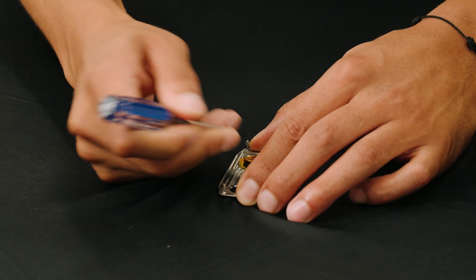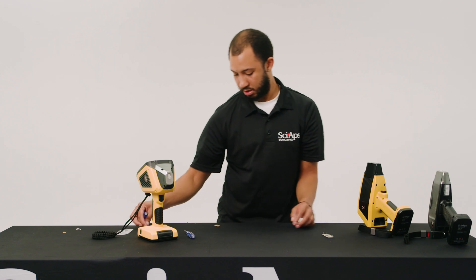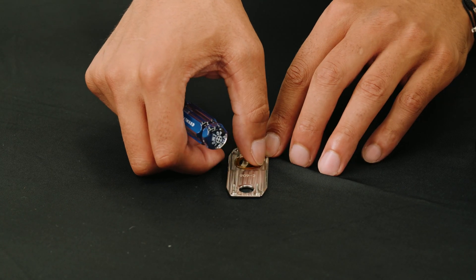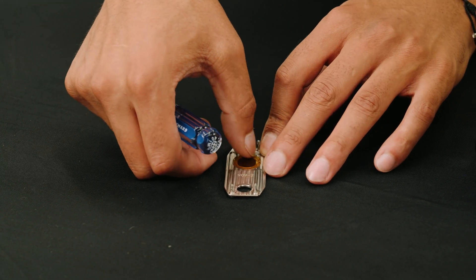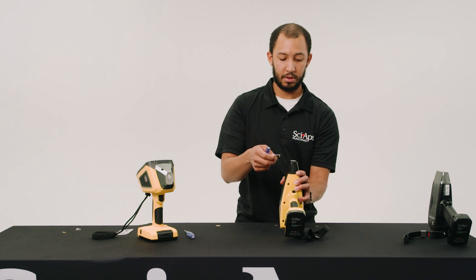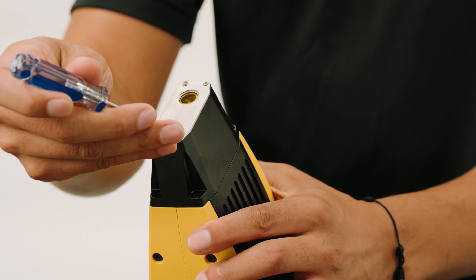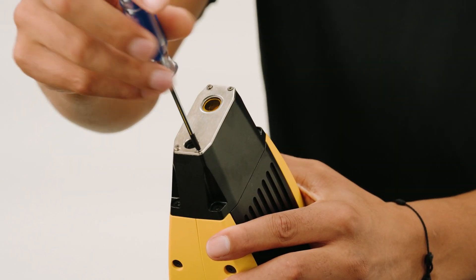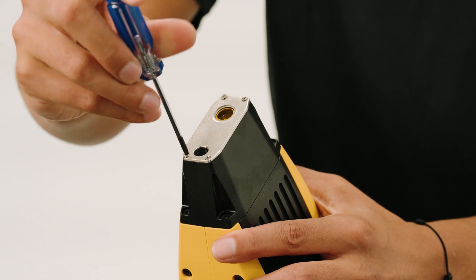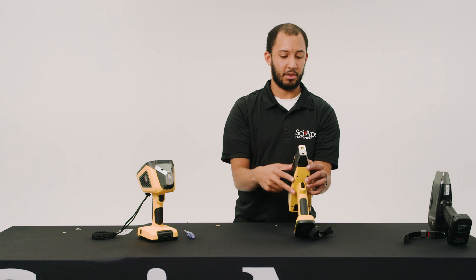Because you will just be putting a brand new one on there. Once flush, you're good to go — put the nose plate right back on the unit. Just like that.